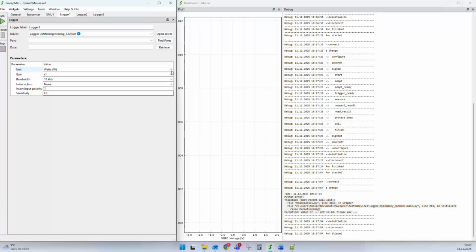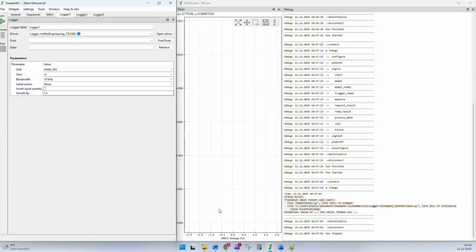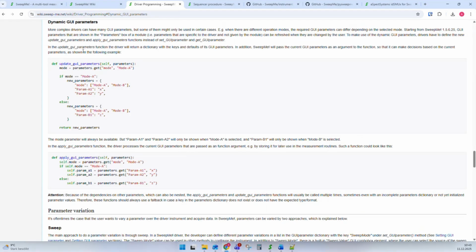You can see here, when we change the unit to a power unit instead of a current, it wants to know the sensitivity. Whether you have to enter the sensitivity or not depends only on whether you have a power unit or a current unit. So if you go to current, it is not shown to the user, so you know you don't have to use it. And if you go to watts, a new field pops up. This is now possible with these dynamic GUI parameter functions, updateGUIParameters and applyGUIParameters. At every step, you get the current selection, and depending on the current selection, you can change again what is shown to the user. It means SweepMe will iterate through these functions until there is no further change. This is how you can make the user interface more and more intuitive to the users and only provide the options that are really needed.